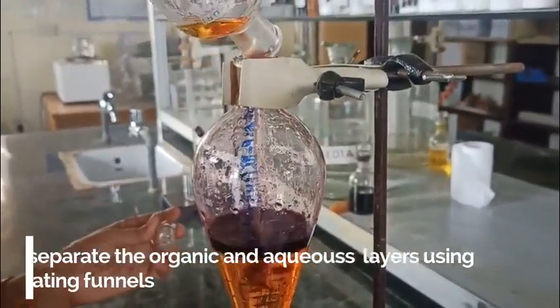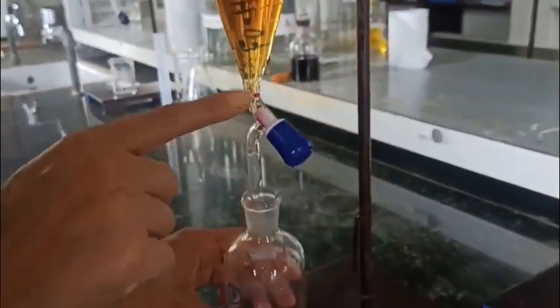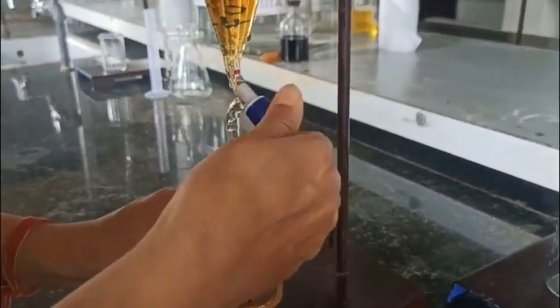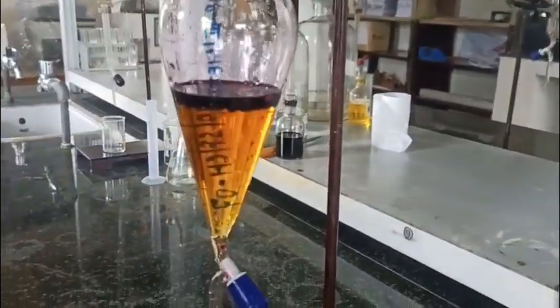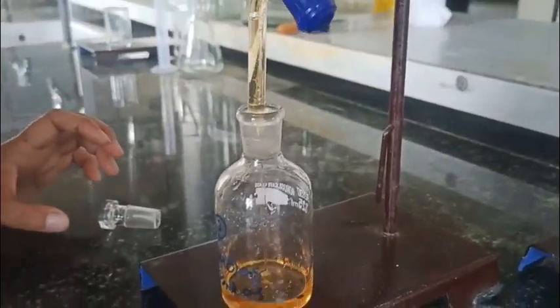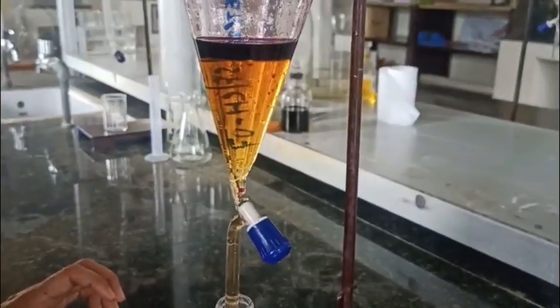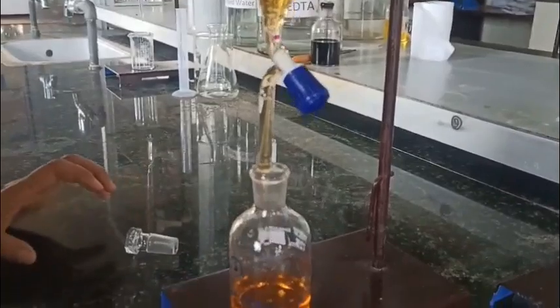So to separate the organic and aqueous layer, we are transferring the solution from the reagent bottle into the separating funnel. So here you can clearly see the aqueous and the organic layer. This aqueous layer which is at the bottom, we are going to collect in the reagent bottle.